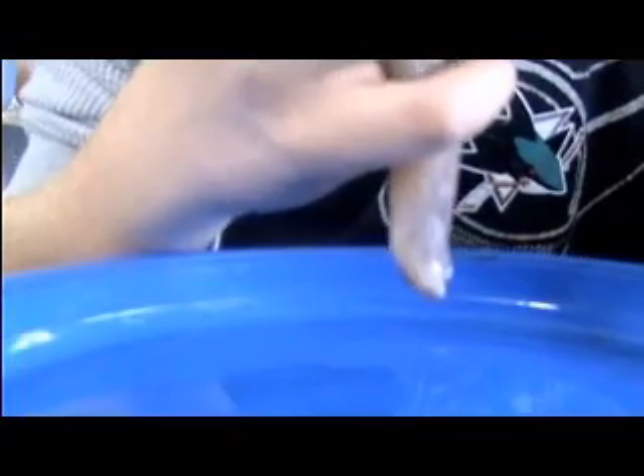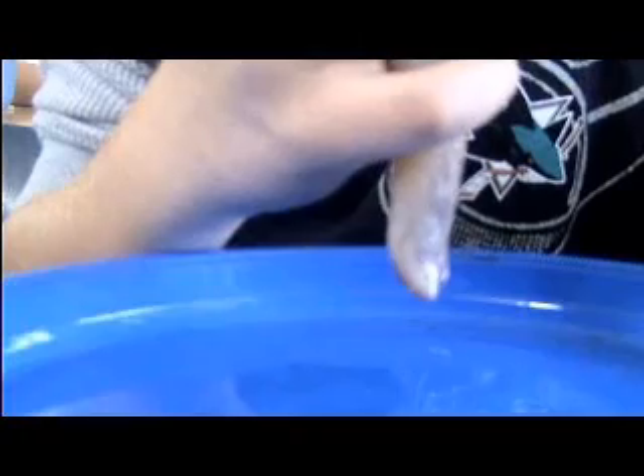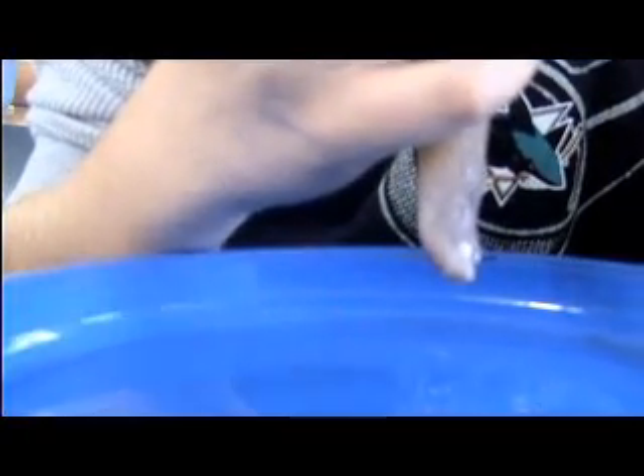Found the anus? It's called the anus. Almost got it from its mouth.